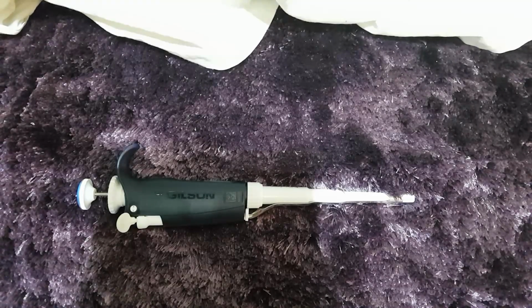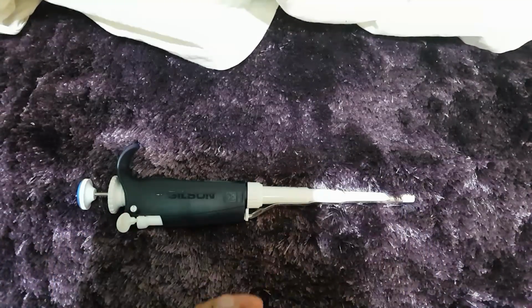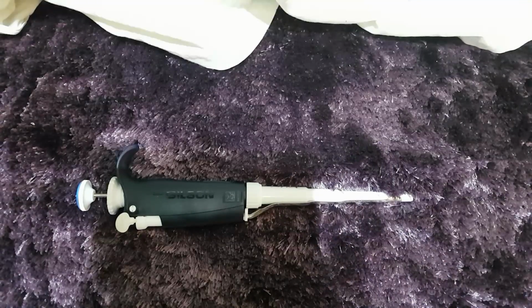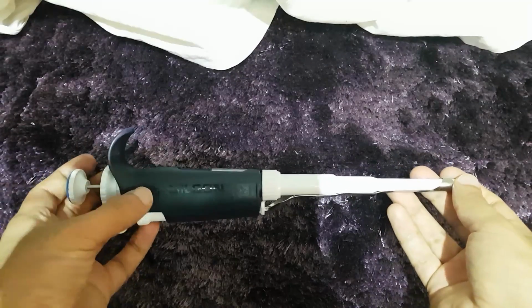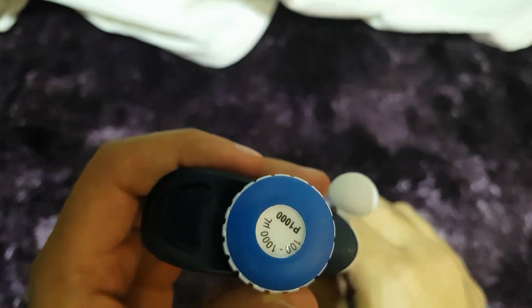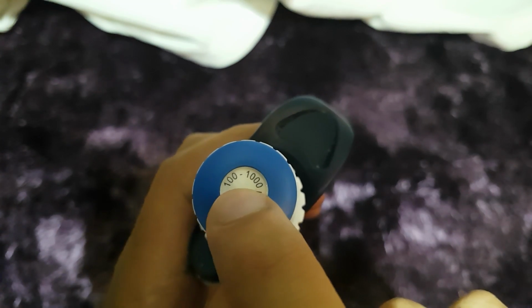Today, we're going to be learning how to use a pipette, the different parts of a pipette, and also how to fix a blocked pipette. So, what we have here is a Gilson Pipetman. Here we can see the brand Gilson, and on the other side it says Pipetman. The pipette in question here is a P1000 pipette.